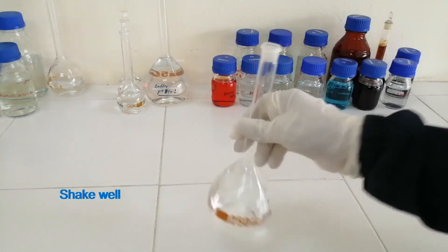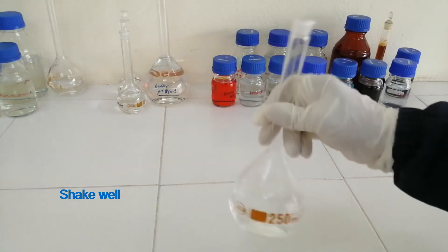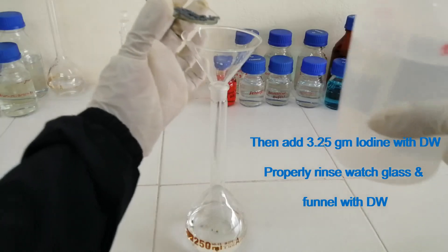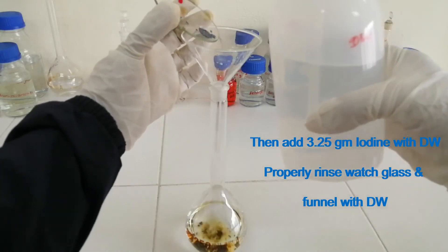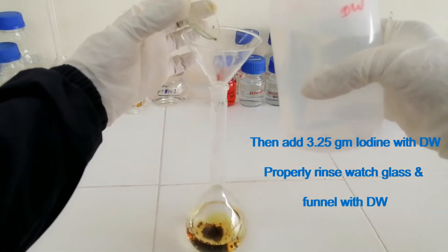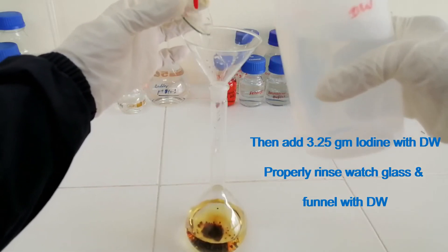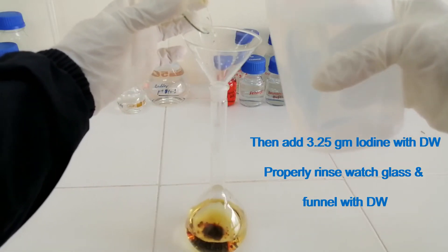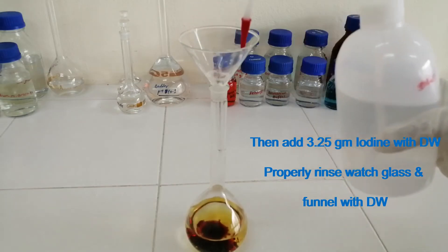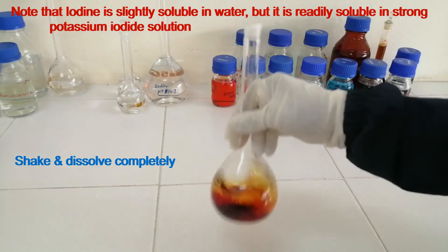Shake well. Then add 3.25 g of iodine with distilled water. Properly rinse the watch glass and funnel with distilled water. Shake and dissolve completely.